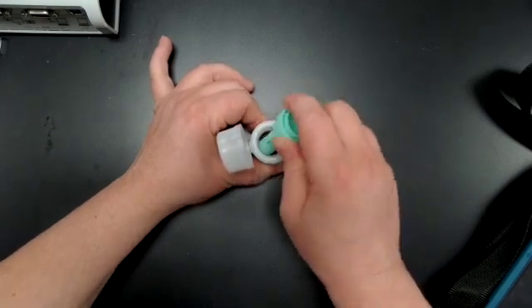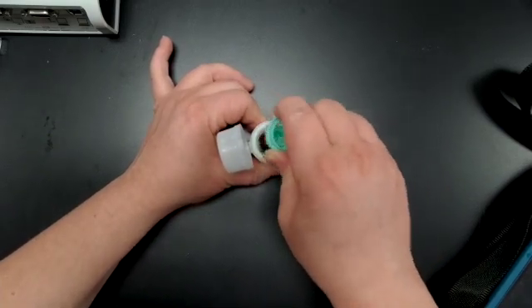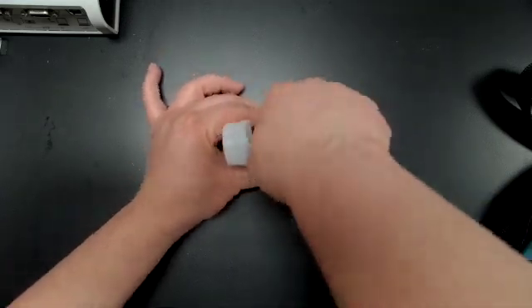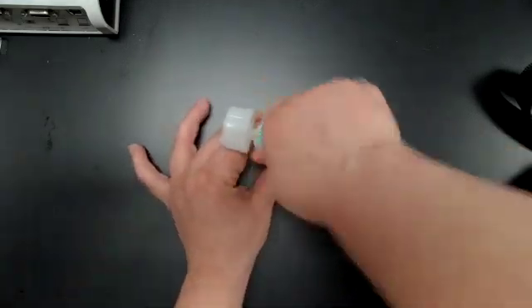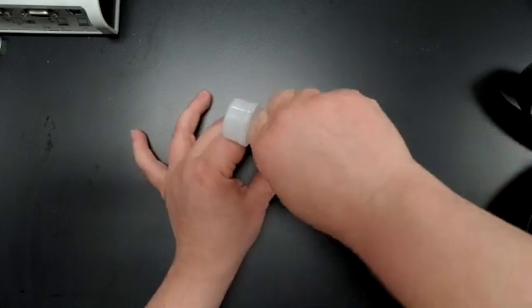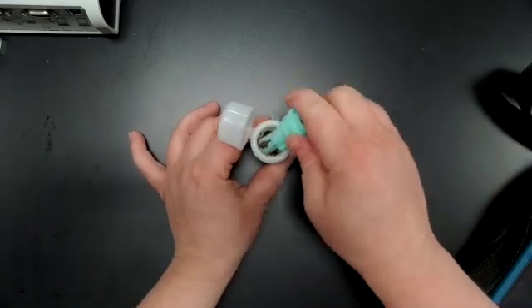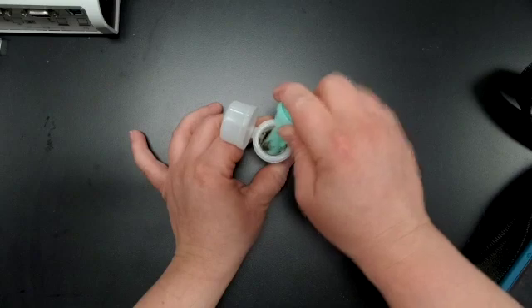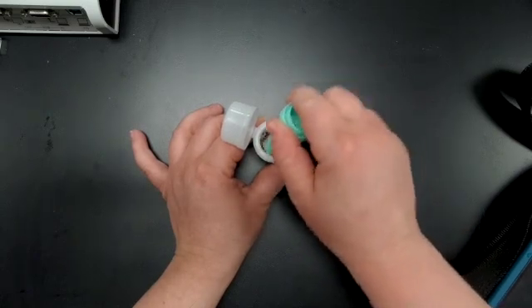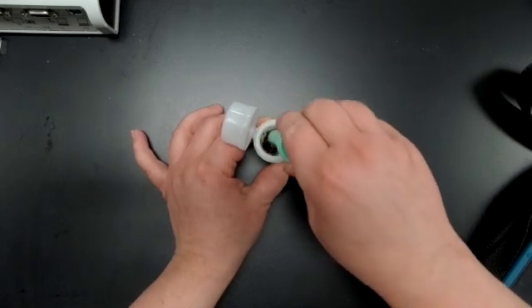So with students, this is one of the things, just making sure everything gets ground up really well. And is it stuck anywhere? I'm looking for almost like a milkshake, like a really thin milkshake solution.